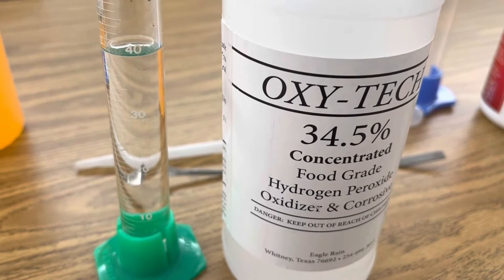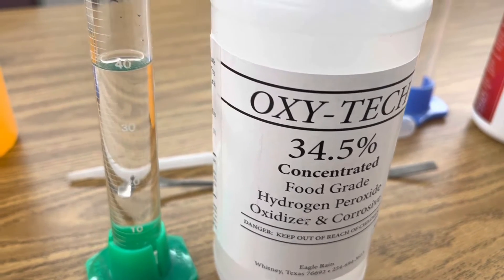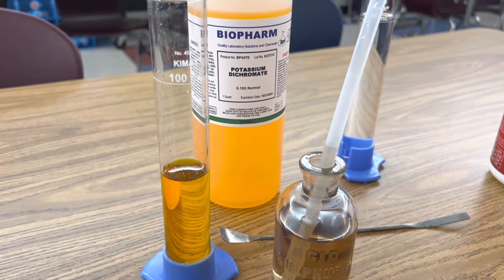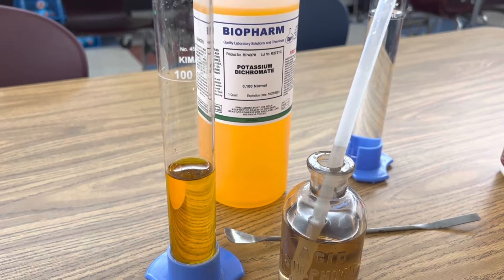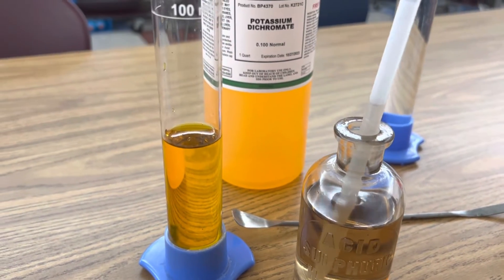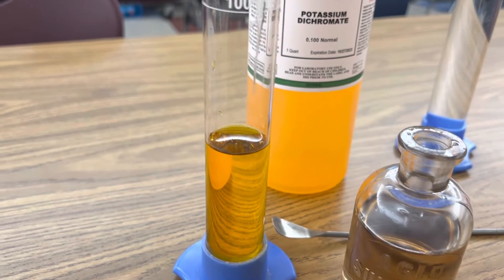The first step is just to pour 40 milliliters of 34% hydrogen peroxide into your first graduated cylinder. Next, add 50 milliliters of potassium dichromate to your second graduated cylinder and acidify it by adding just a few drops of 18 molar sulfuric acid to your solution.